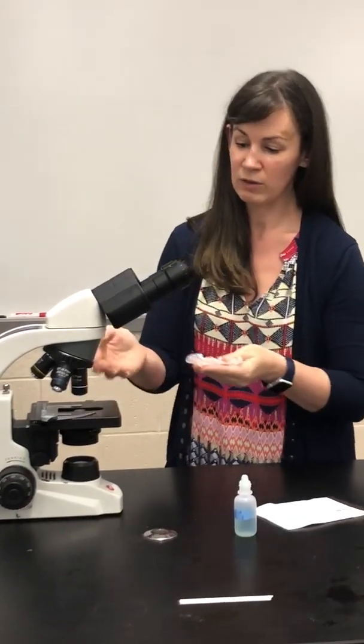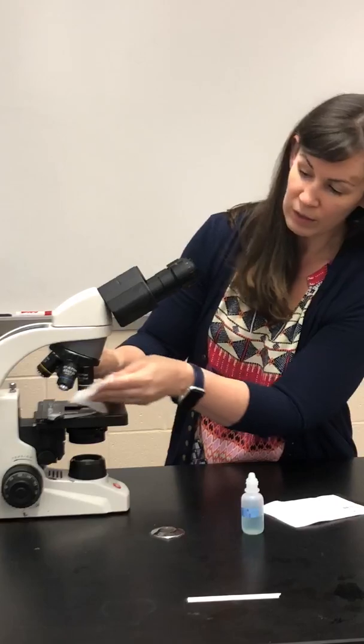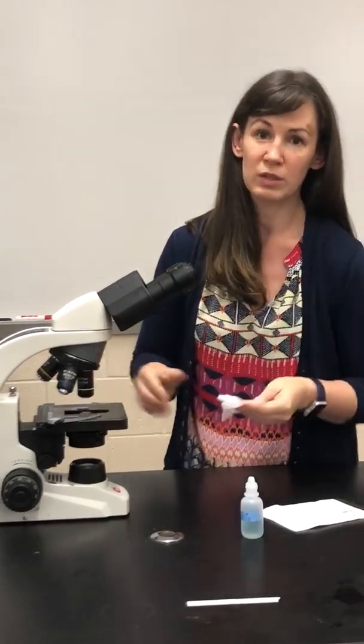When you are done, you can always check yourself by using a clean piece of lens paper to see if there's any oil left. Additionally, if you get oil anyplace else, like on the stage, on the condenser, or on any of the other objectives, make sure that you clean that oil off.